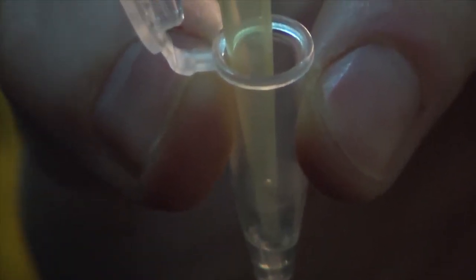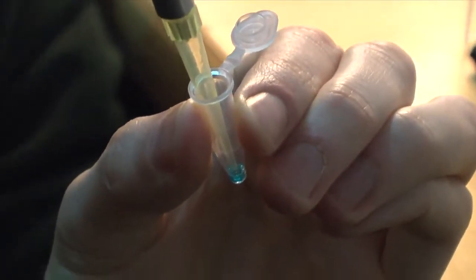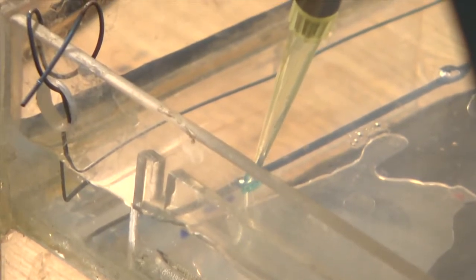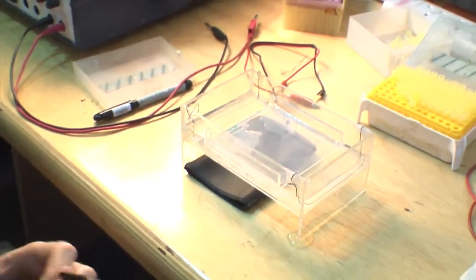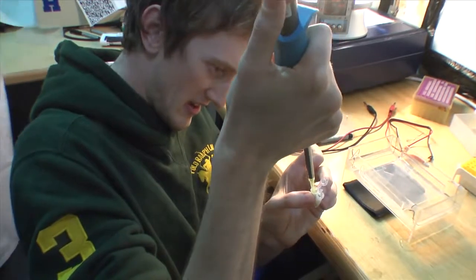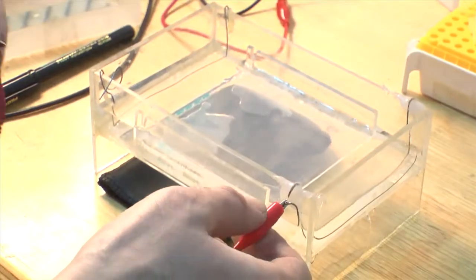So I'm going to add 15 microlitres of each sample and add it to 3 microlitres of loading buffer which is in here already, and then take another 15 of that and put it in the gel. Now we're going to add the DNA extractions that have not gone through PCR — this is the gDNA, so it's just genomic DNA that hasn't gone through PCR. The gel is ready, so now we just hook up the power — DNA migrates towards the positive.